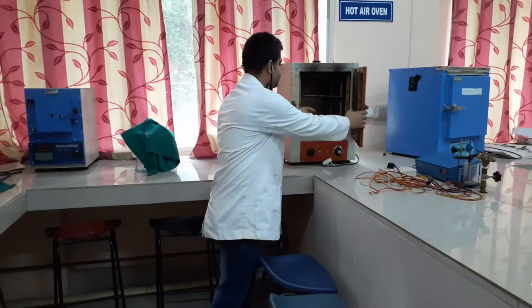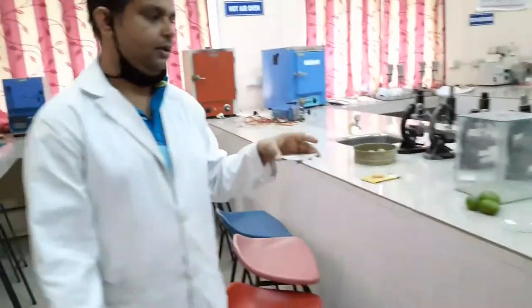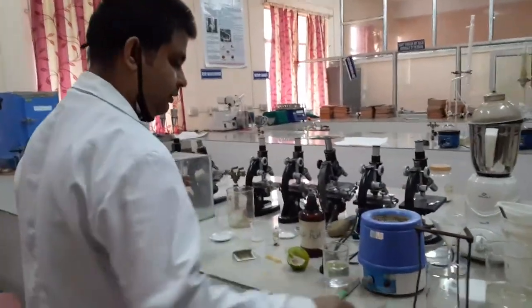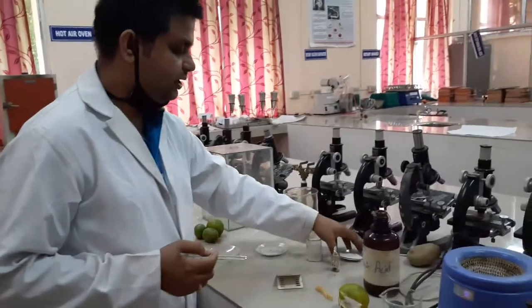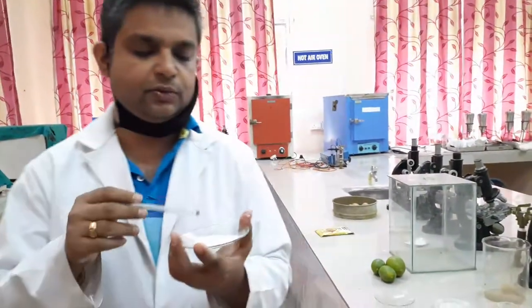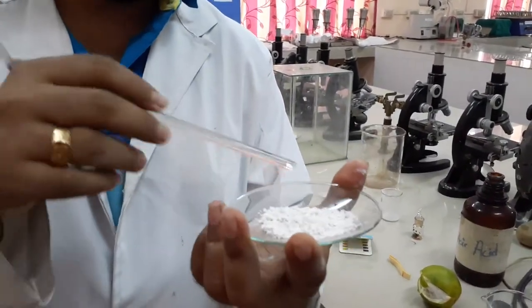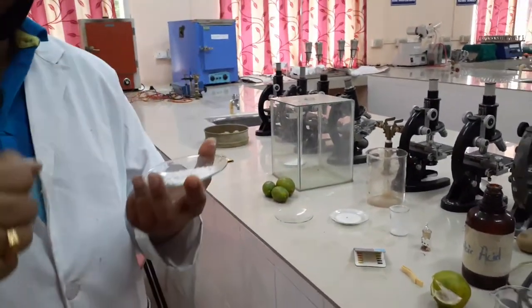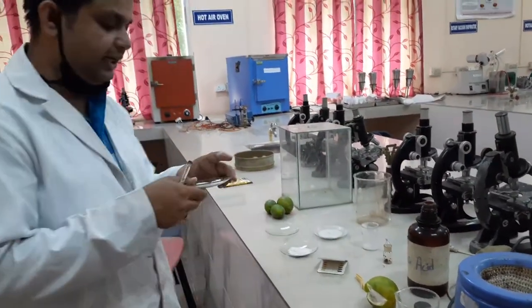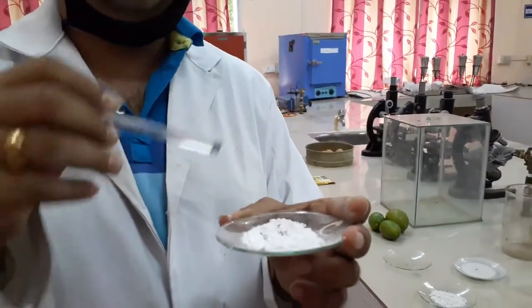Take it out and stir it. Upon stirring, you will find a little whitish or yellowish-white lump. You can see the lump here. Now you transfer it into a mortar and pestle and you triturate it. The final product you are getting is the powder of pectin.